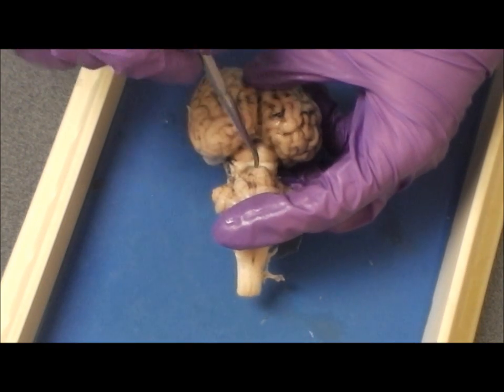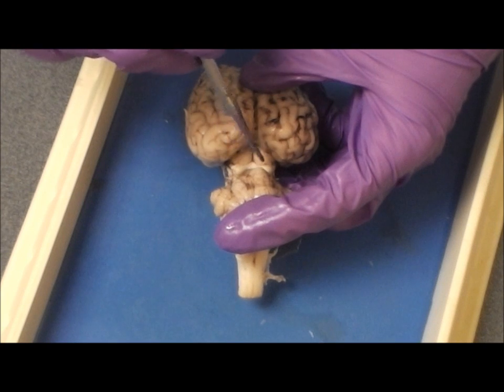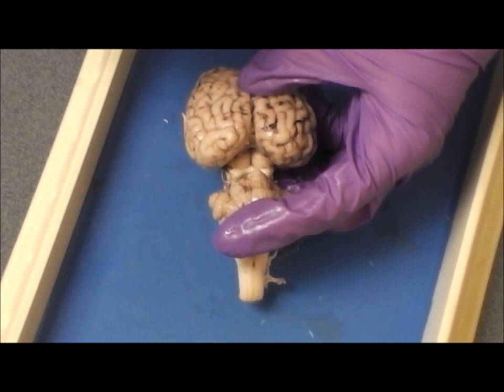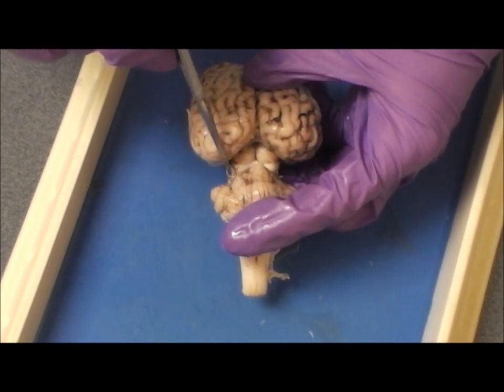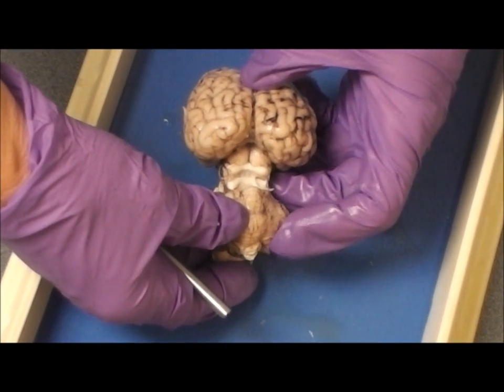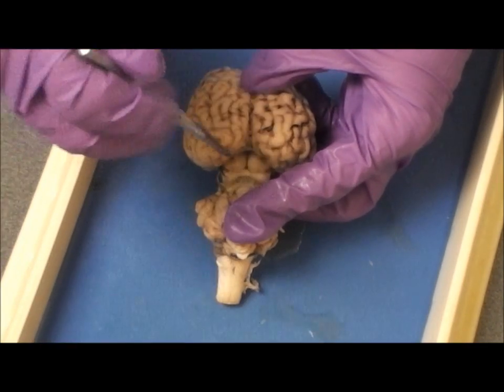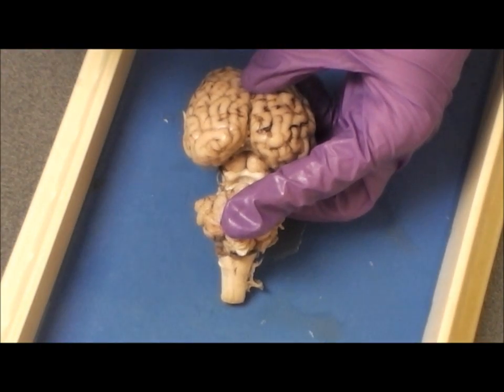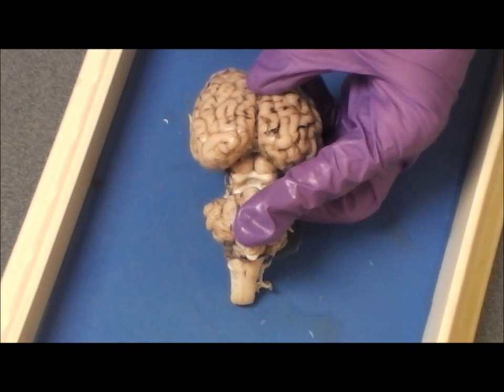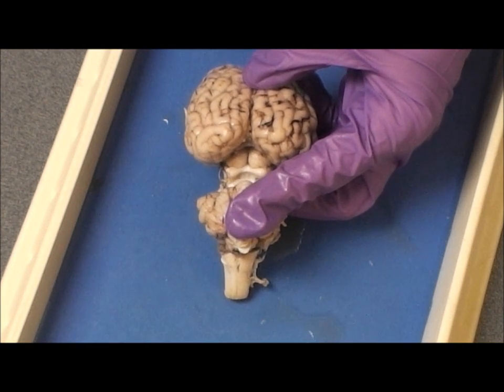The two superior bumps are the superior colliculi, and the two inferior bumps are the inferior colliculi. The superior colliculi are associated with the sense of sight, and the inferior colliculi are associated with the sense of hearing.